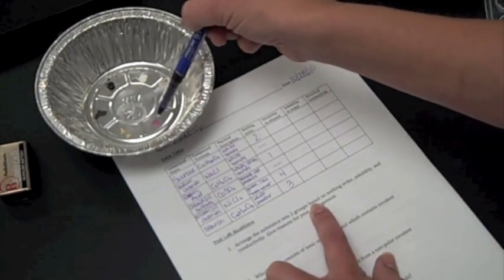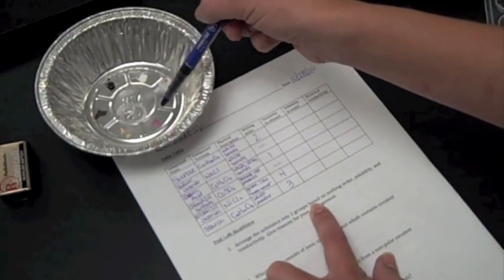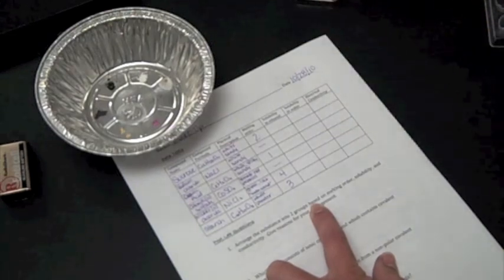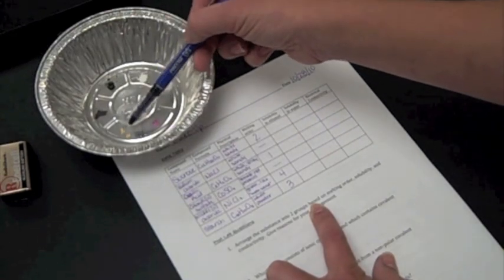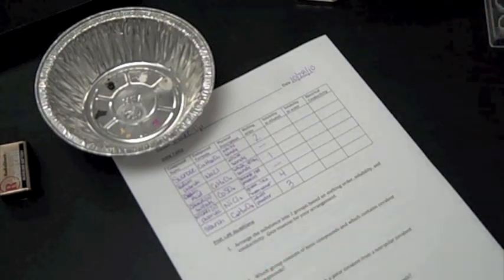And then you can see the table salt and the cobalt sulfate. They didn't melt at all. So we're just going to call them not melted. Yes, it did. The cobalt sulfate did change color a little bit, but it didn't actually change form. So melting implies solid to liquid. And that definitely didn't happen here, but it did happen with the nickel chloride.